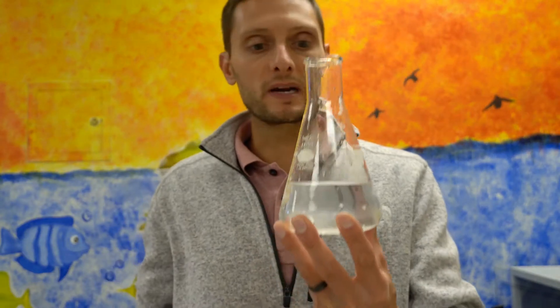I'm going to put this into the microwave and heat it for a couple of minutes until all of the agarose dissolves. When dissolved, it will look like water. Once all the agarose is dissolved, I'll add phenolphthalein to the agarose liquid and pour it into a container to cool. Once cooled, it forms a jelly-like substance that we'll cut into cubes to make model cells.